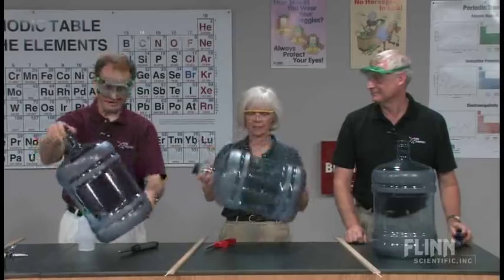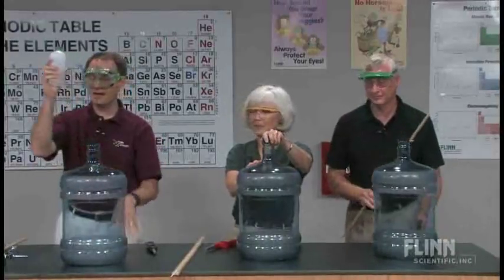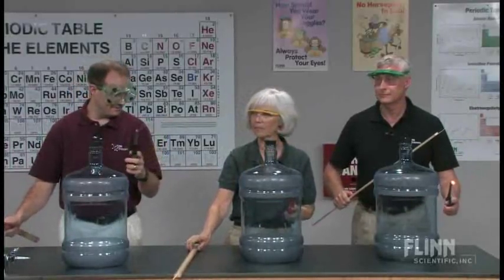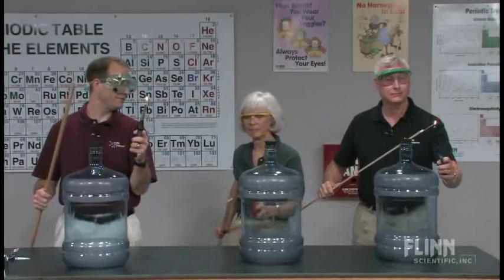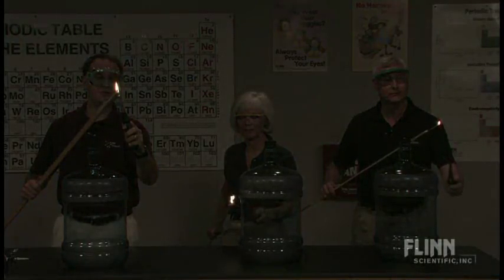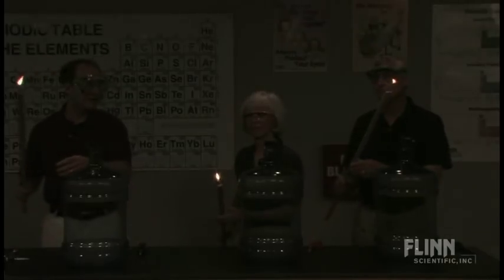I'm feeling ready. We're going to move the excess alcohol a safe distance away, with our left hand on the aim and flame. Light aim and flame. Lighting splint. The meter stick with the wooden splint will allow us to be a greater distance away from the bottle.